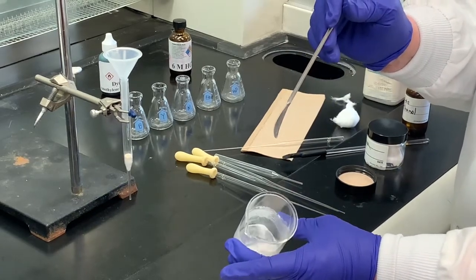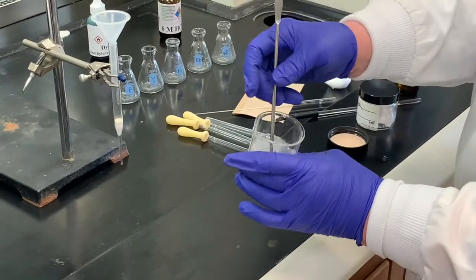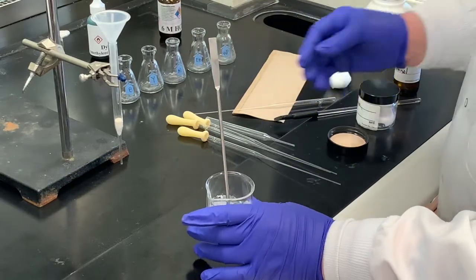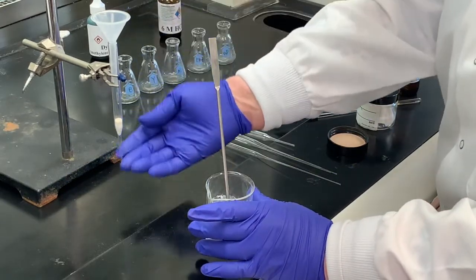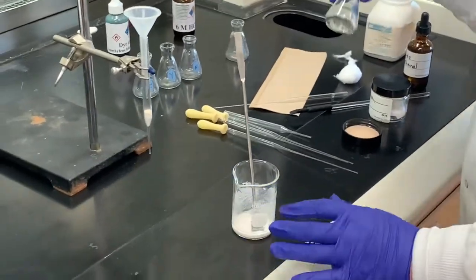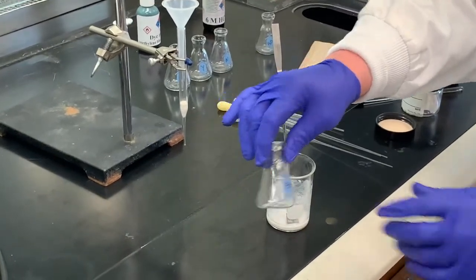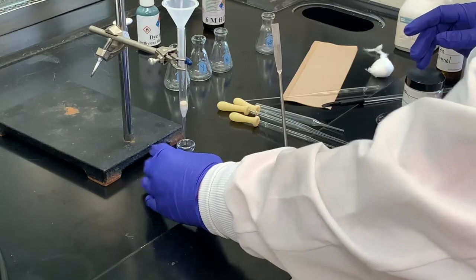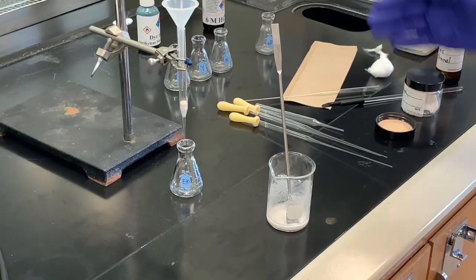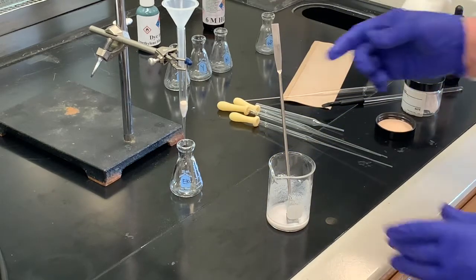But what I want to do, I'm going to pour this into the funnel, making sure I don't go over. And the other thing I want to make sure, because as soon as the liquid hits this and it goes down, we can start collecting the liquid. I'm going to use, since the solvent I'm using now is ethanol, I'm going to use my flask that's labeled ethanol to catch anything that drips through. And before I use or apply my sample, I can reuse that ethanol as my solvent because nothing's gone through except the ethanol at that point.